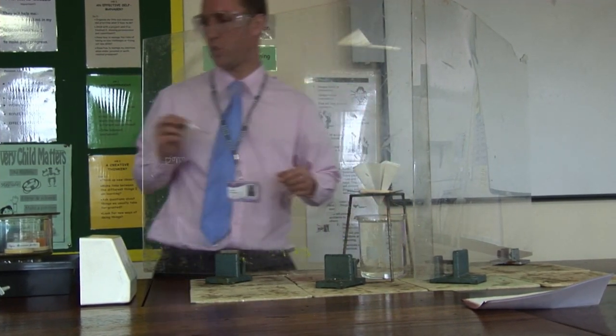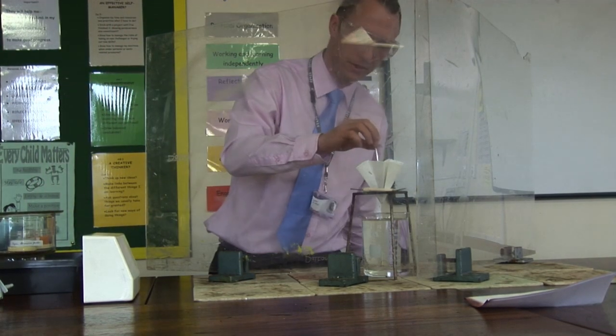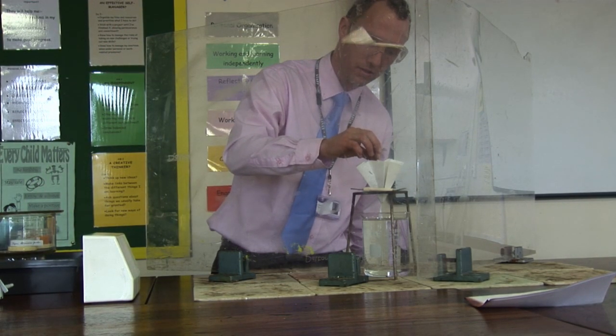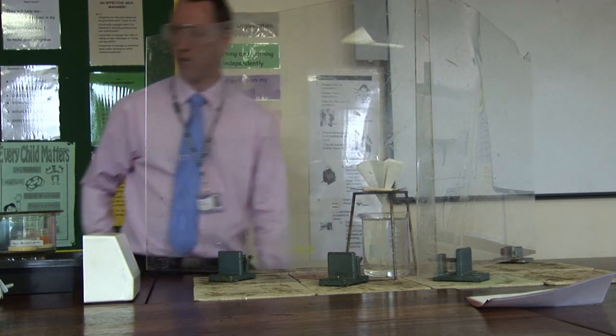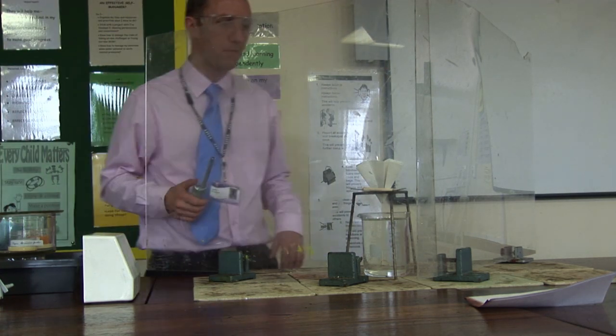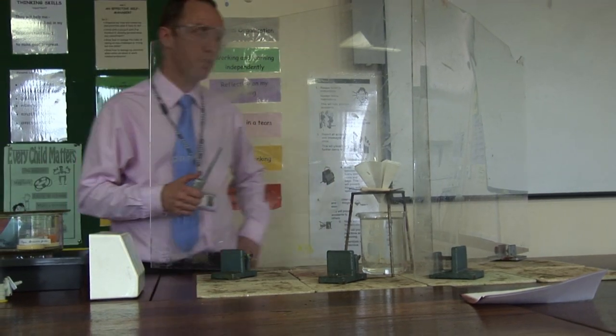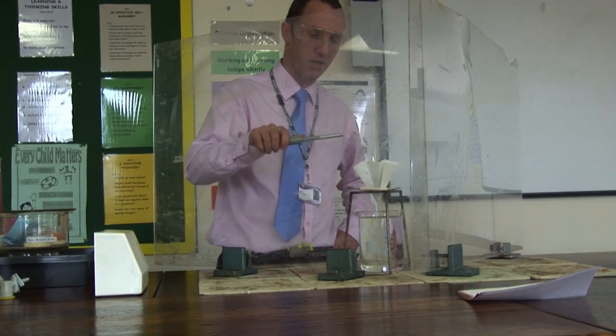Now, placing in the top what we're using is our fuse, which is about 10cm of magnesium tape. We're going to light that and that's going to initiate the displacement of the molten iron from the iron oxide by the aluminium powder.